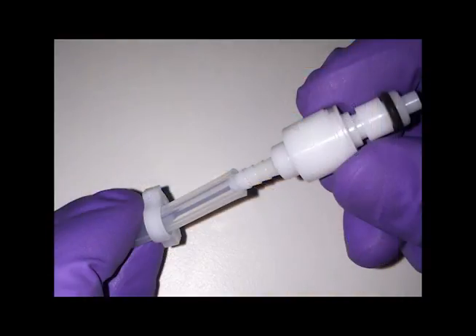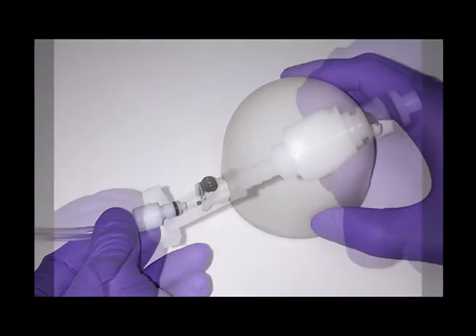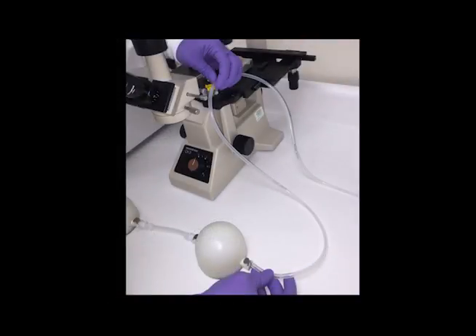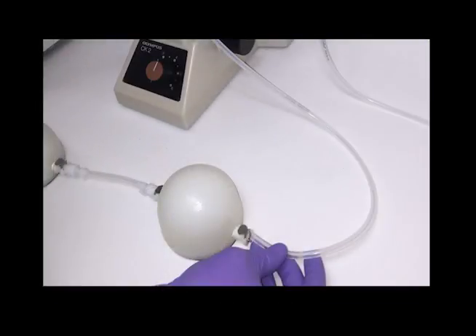Slide a small tubing clamp onto the free end of the tubing and connect to the barbed end of another male quick disconnect. Connect this quick disconnect to the first pulse dampener. Connect small tubing clamps and a male quick disconnect to both ends of a 3–4 inch (7.6–10.2 cm) long segment of clear silicone tubing. Use this tubing to connect the first pulse dampener to the second pulse dampener. Cut another length of tubing long enough to reach from the second pulse dampener to the FlexFlow device. Connect the barbed end of a male quick disconnect to the tubing with a small tubing clamp, connect this quick disconnect to the second pulse dampener, and leave the other end of the tubing free.